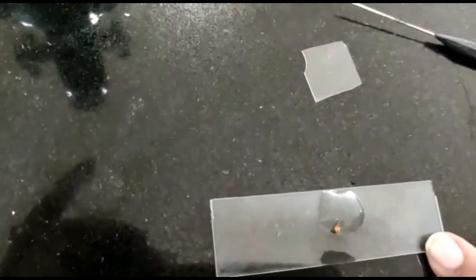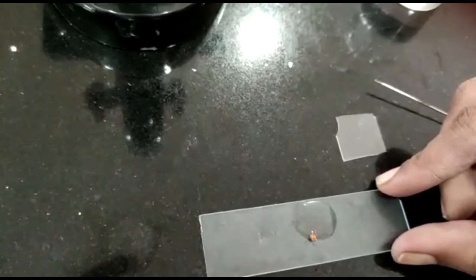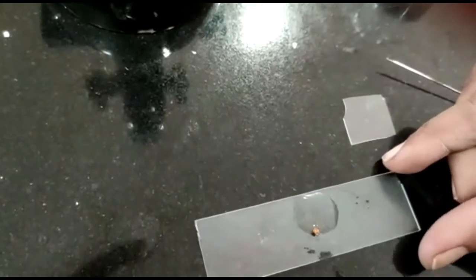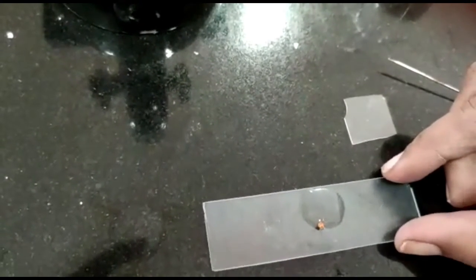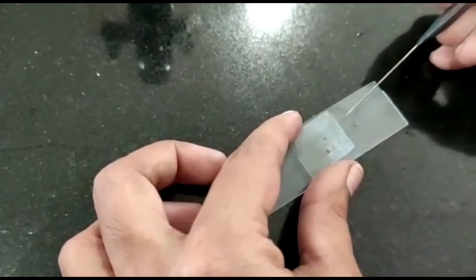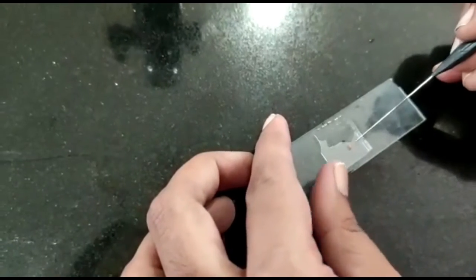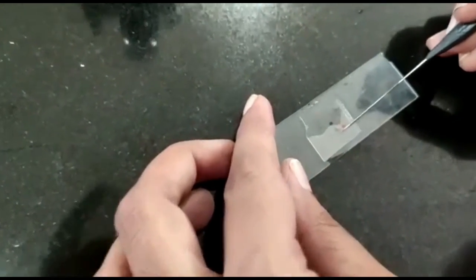We have to observe this slide in the microscope after five minutes, and then observe it regularly for about half an hour at an interval of five minutes each observation. In the nutrient medium, the pollen grain germinates — the tube cell enlarges and comes out of the pollen grain through one of the germ pores to form a pollen tube. The tube nucleus descends to the tip of the pollen tube.